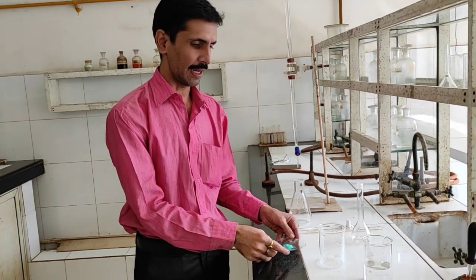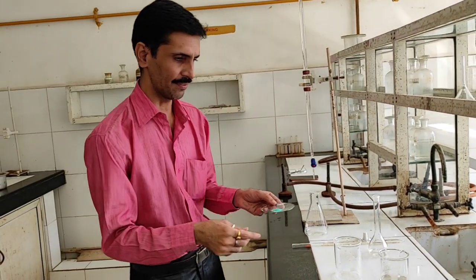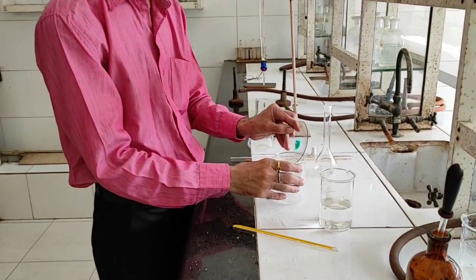0.5 grams. Now I'll tell you over here, because whenever we have to carry out the quantitative analysis of a major cation, it's very obvious you need to know which major cation is present. Here it's not qualitative, it is quantitative. Depending upon the nature of the cation, a particular volumetric technique is followed, with respect to the chemicals and the reagents required. So here I have to declare that the major cation is nickel. I am going to take this mixture of 0.5 grams and dissolve it.